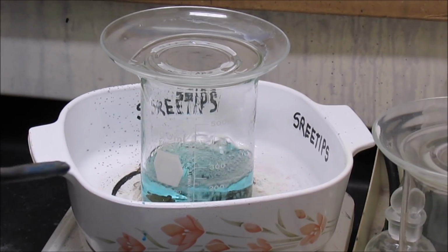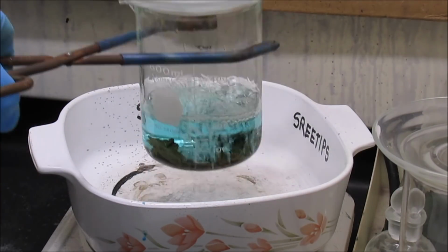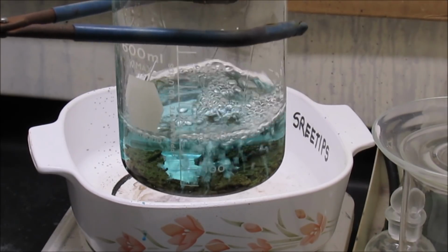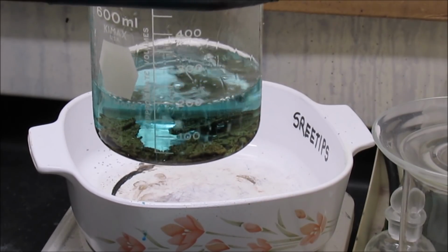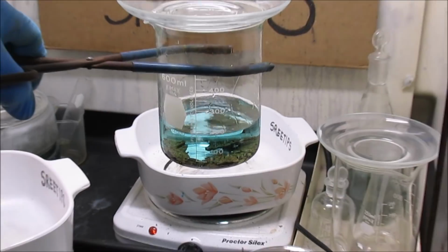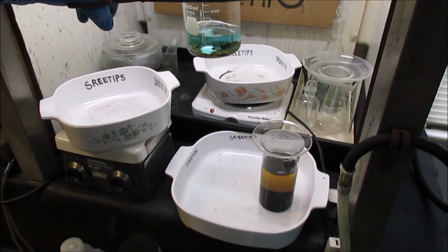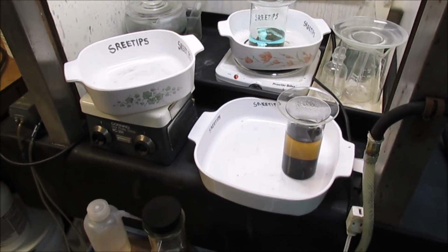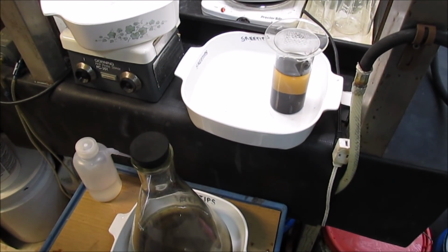Alright, in case you're wondering what I had going on here in the back of the fume hood, this is some gold that I had quartered, that I was parting out the silver and the base metals with dilute nitric acid, and I'm about ready to pour that off and begin dissolving that. But that's a different process than what we're doing right now. What I want to do now is focus back on my PGMs here.